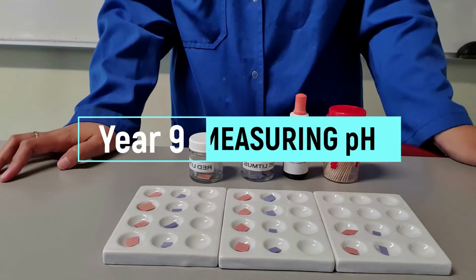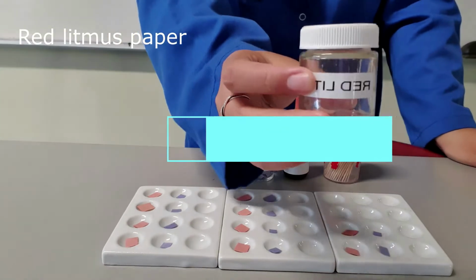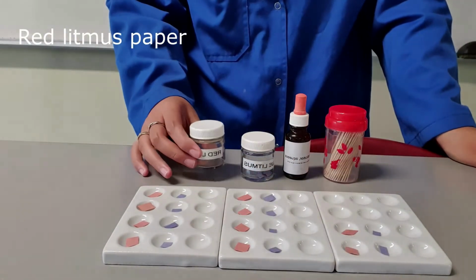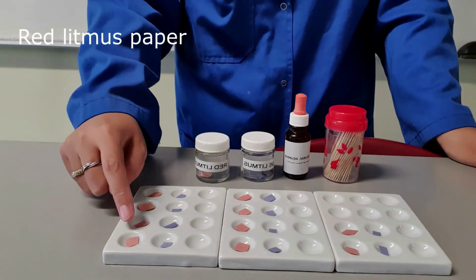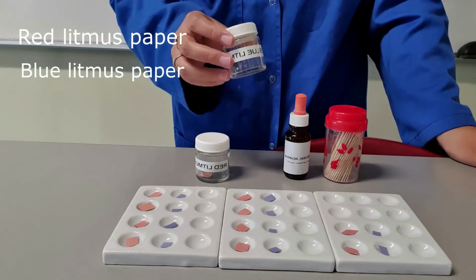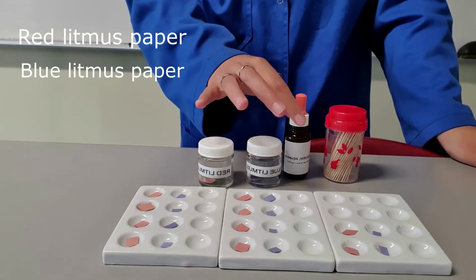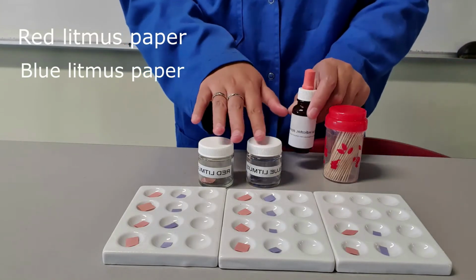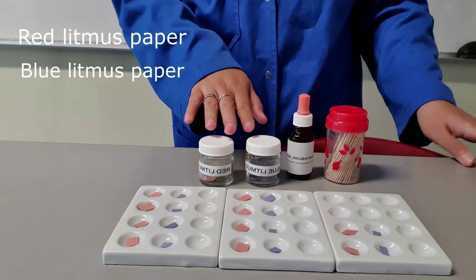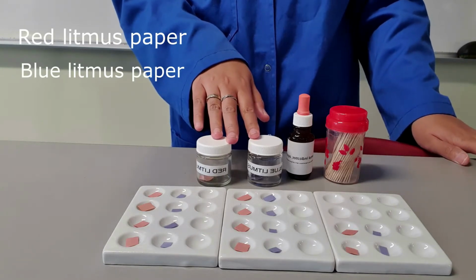In this experiment, we are going to use red litmus paper, which I have placed in these tiles. We will also use blue litmus paper. So these two will help us identify whether something is an acid or a base.